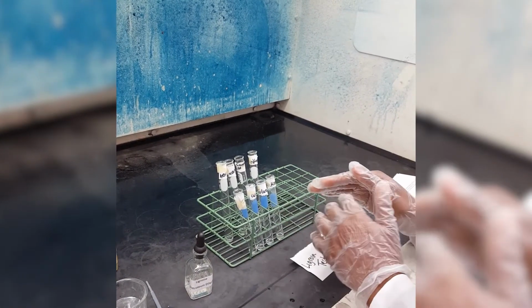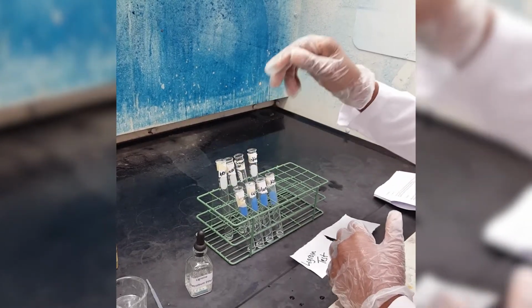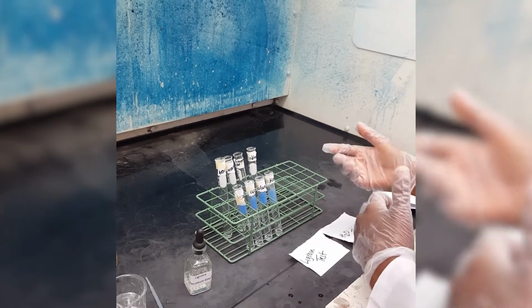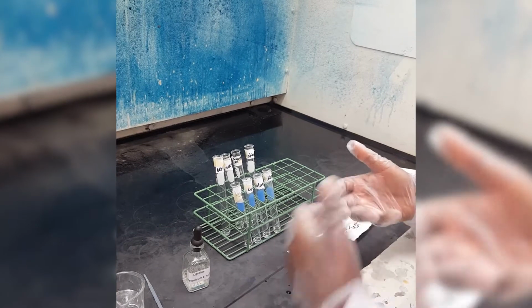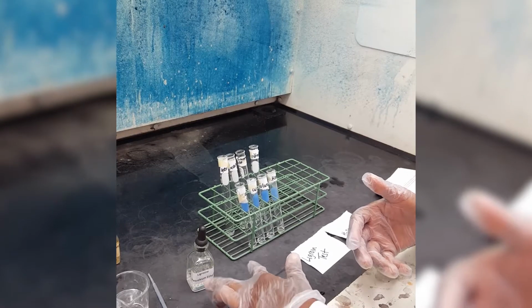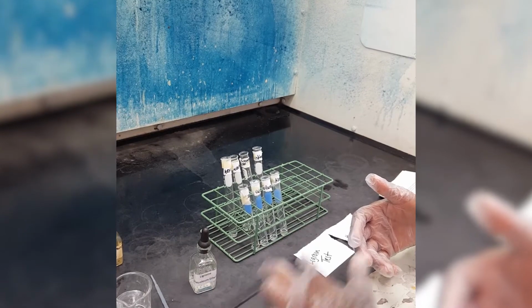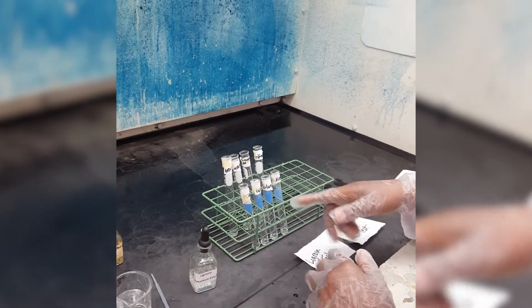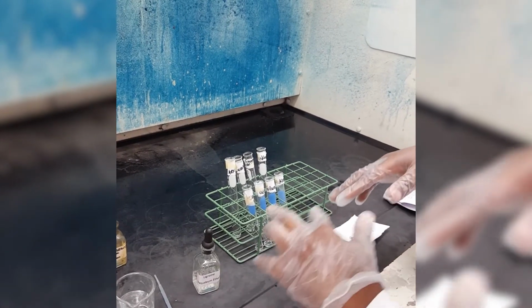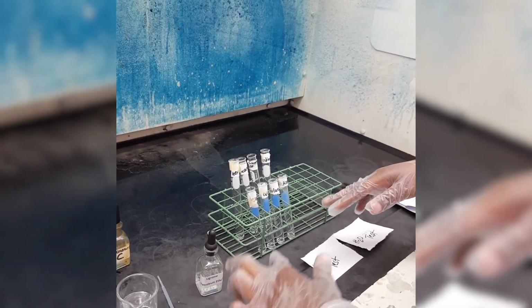So in these substances, we have degrees of solubility. We are testing our knowns, which are hydrocarbons, but some are more soluble in a polar substance than the others, and some are more soluble in a non-polar substance than the others. We know that water is polar, and we know that Ligroin is non-polar. So I want you to pay attention to the solubilities of the hydrocarbon knowns and the unknown in water. Pay attention to the solubilities of the hydrocarbons and the unknown with Ligroin.